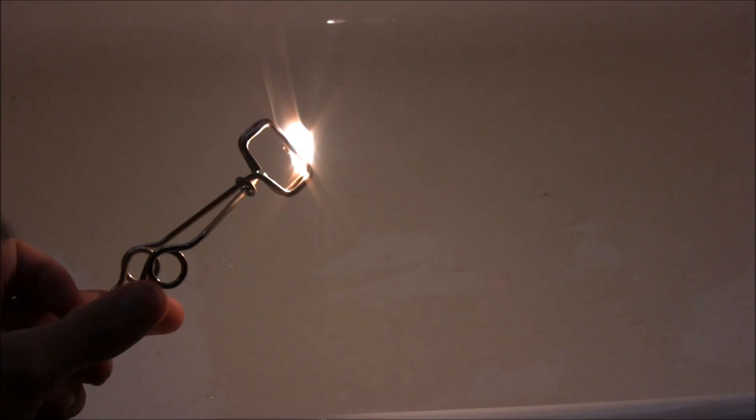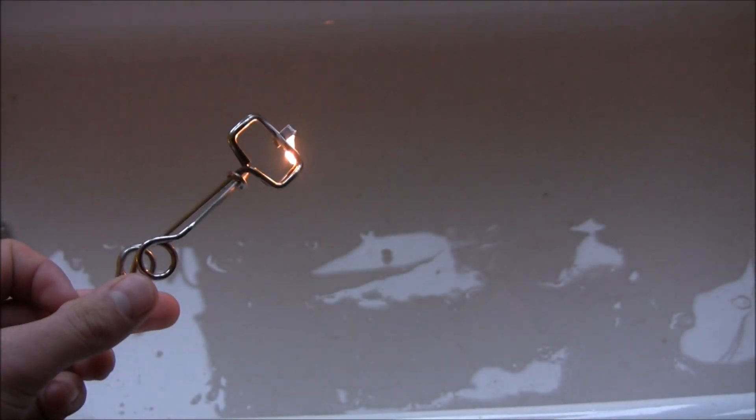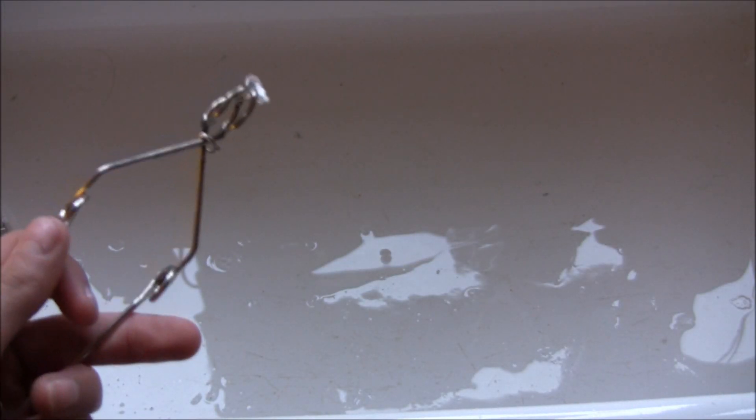Now this is burning brilliant white and it gets quite hot, so we can tell it's an exothermic reaction because it's given out that energy.